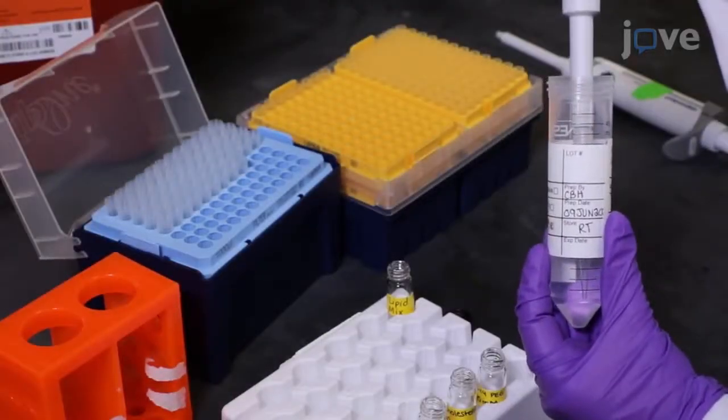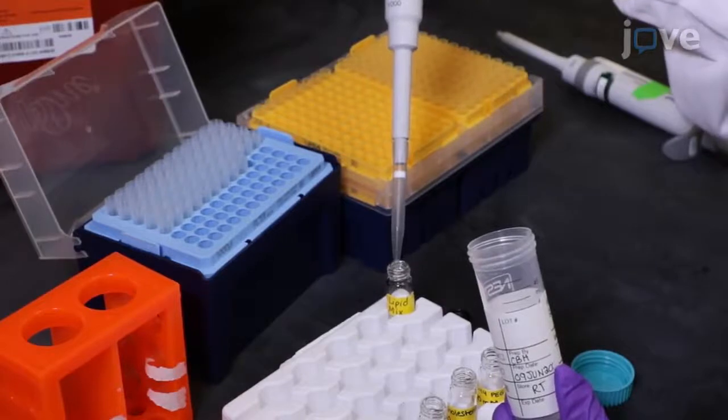Followed by the addition of 200 proof ethanol to a final volume of 533 microliters.